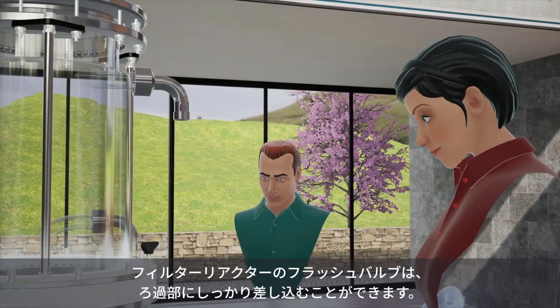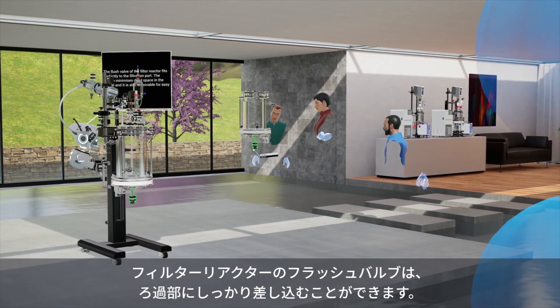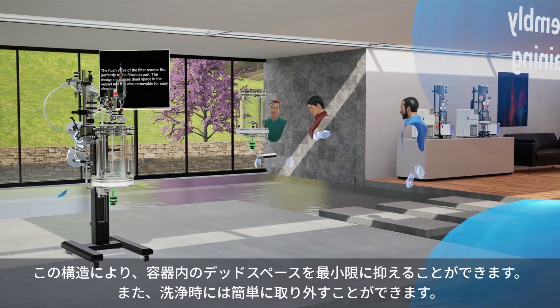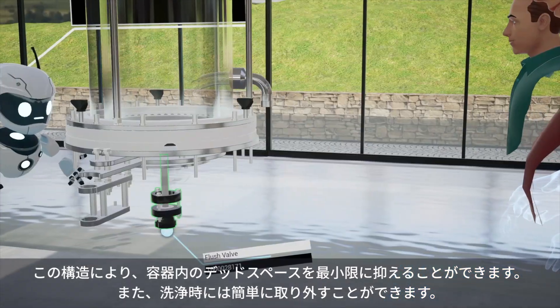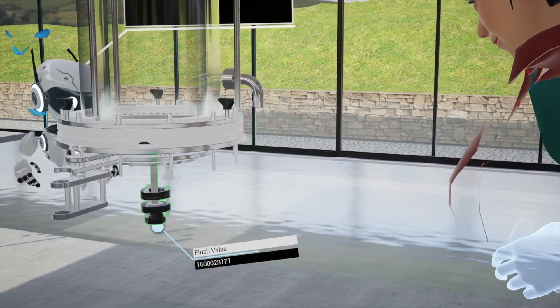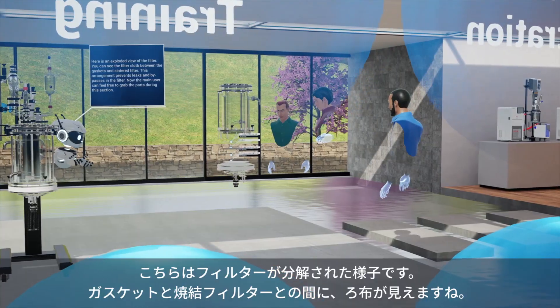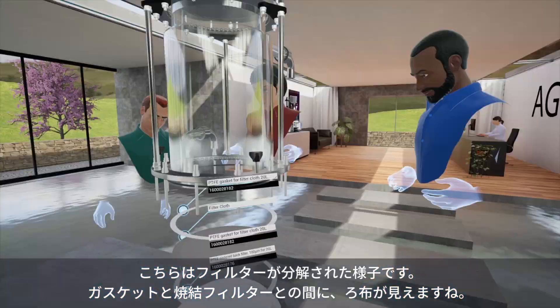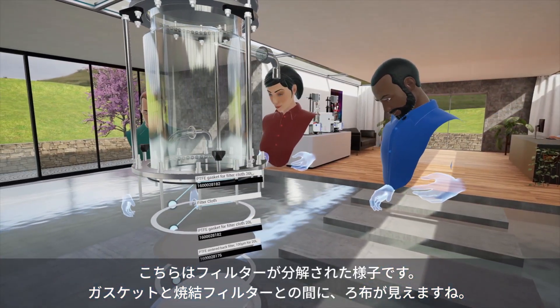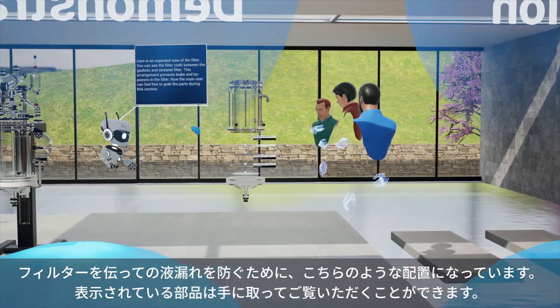The flush valve of the filter reactor fits perfectly to the filtration part. The design minimizes dead space in the vessel and it is also removable for easy cleaning. Here is an exploded view of the filter. You can see the filter cloth between the gaskets and sintered filter. This arrangement prevents leaks and bypasses in the filter.